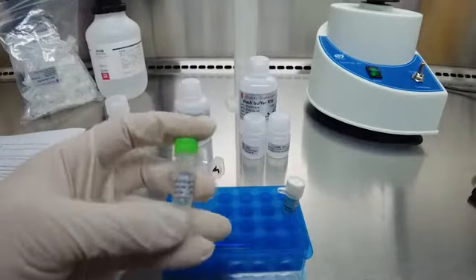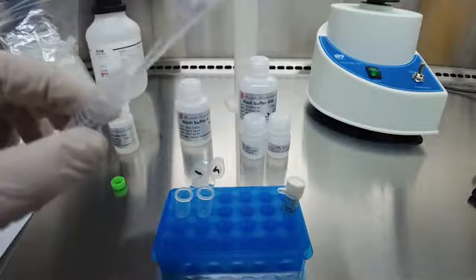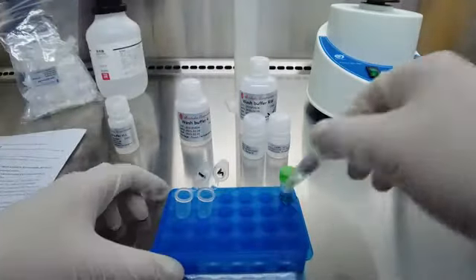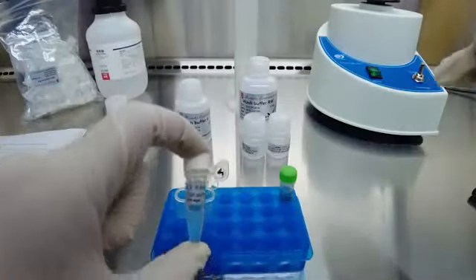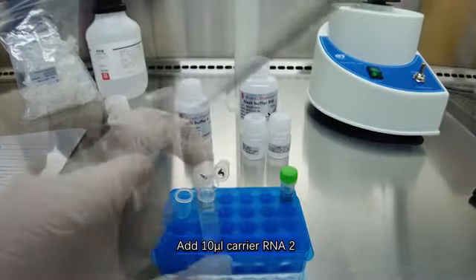Add 25 µL Proteinase K. Add 10 µL Carrier RNA2.